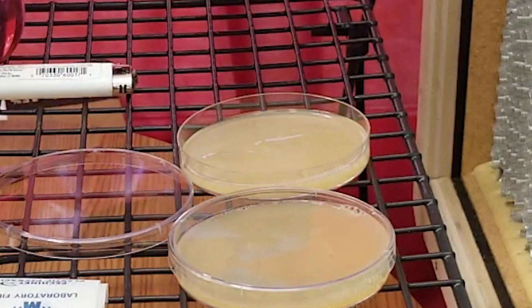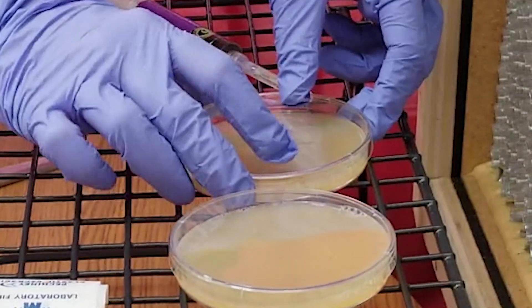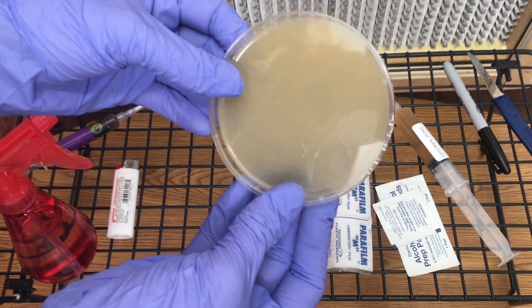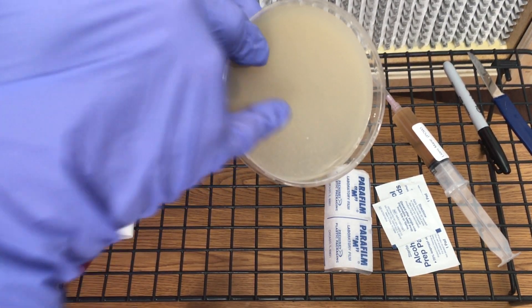In this video it's extremely hard to see the spores, but you can see the liquid dripping down and there are specks of spores that you can't really see in the video but they are on the agar.